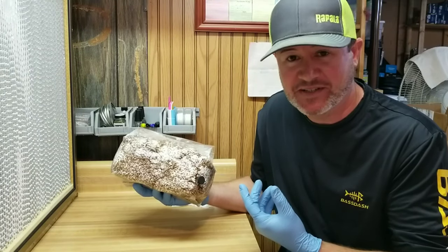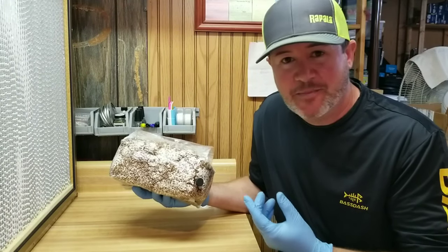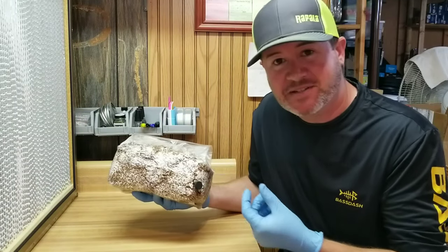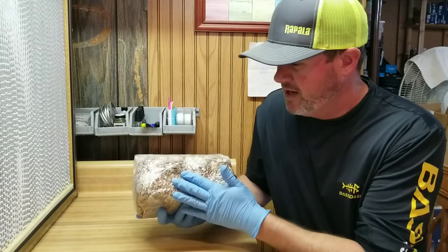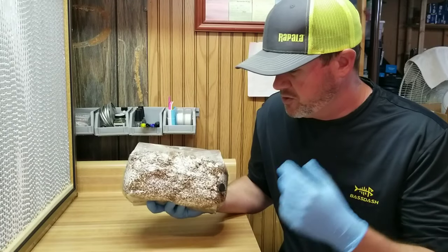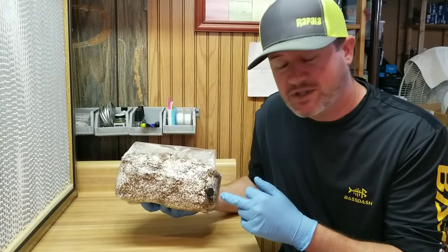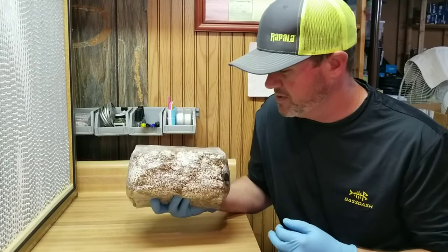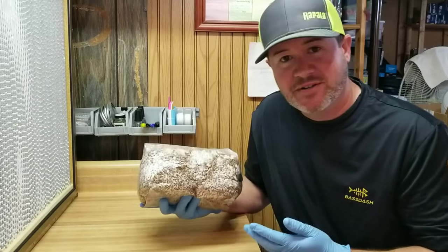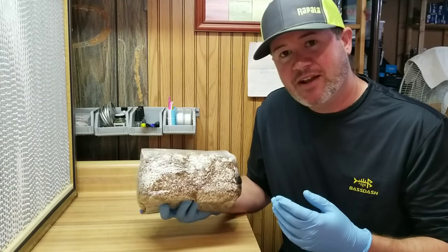I'm going to shoot in about 20–25cc and I may only get 5–10cc back out — you're not going to recover all of it. But I'll get some nice mycelium-laden liquid culture out of this bag and still be able to use the spawn, because the nutrient broth I'm injecting is sterilized and the puncture hole heals right back up with the injection port. Probably in a day or two I'll go ahead and use the spawn to get an oyster grow going as well.